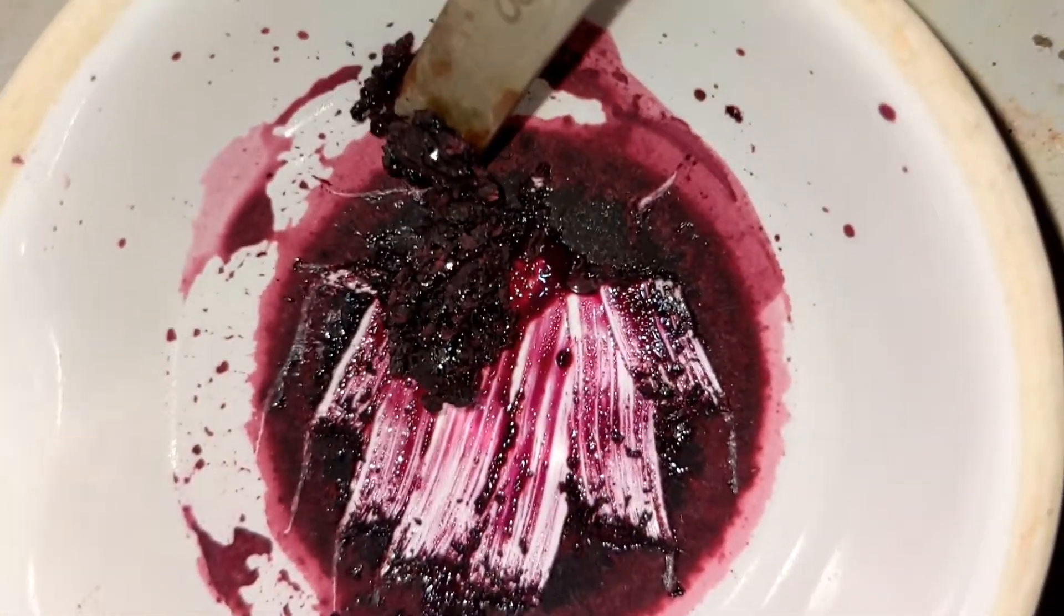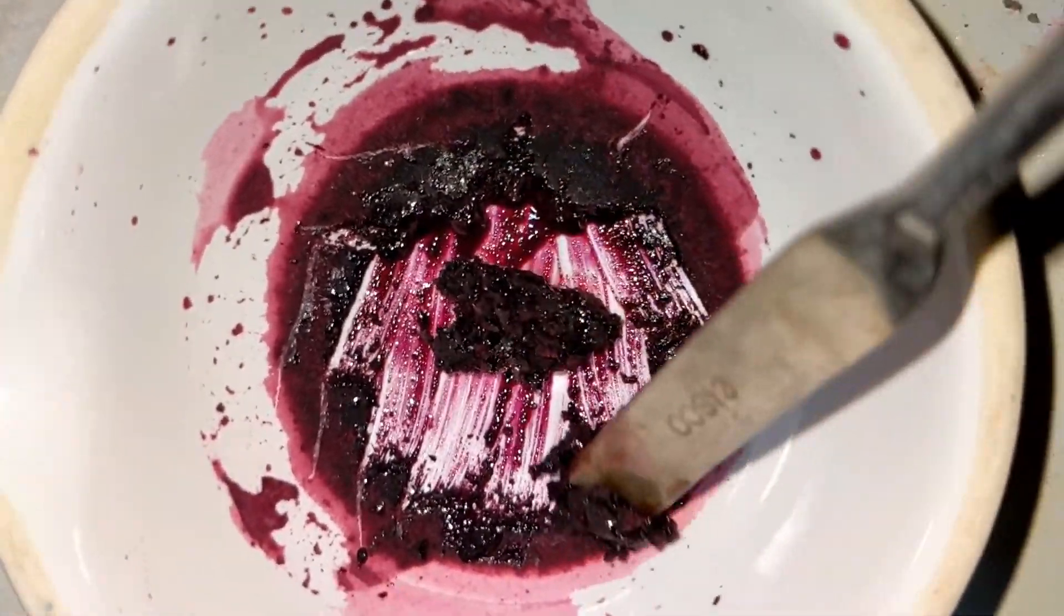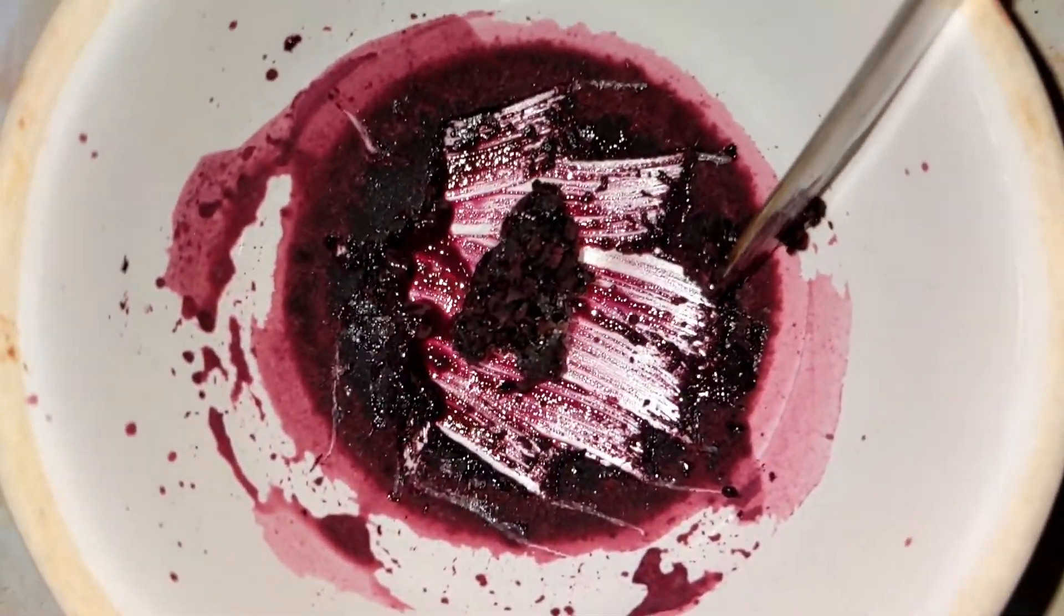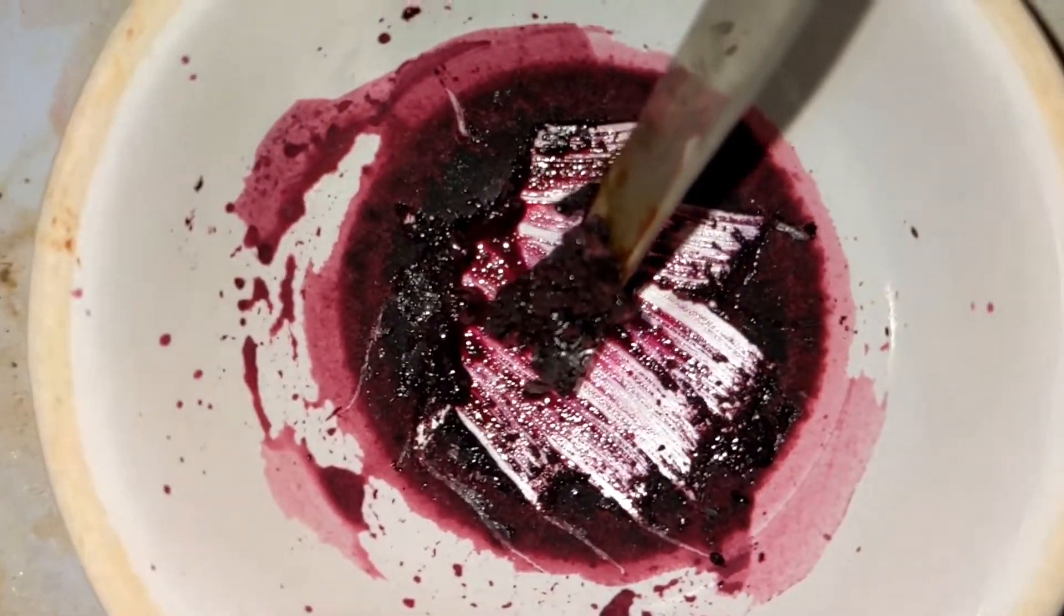After evaporating, what I got was a very thick paste. It contains both the crystals, as I can see the crystalline structure, and a precipitate.